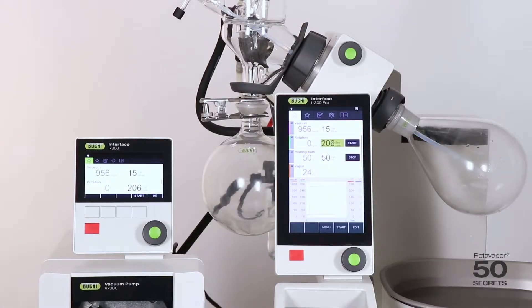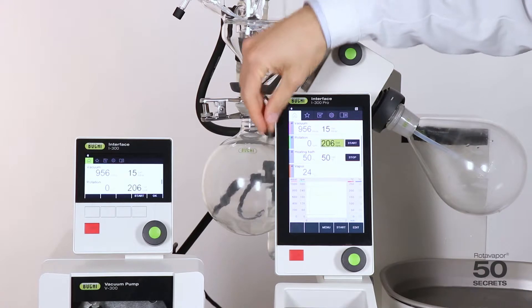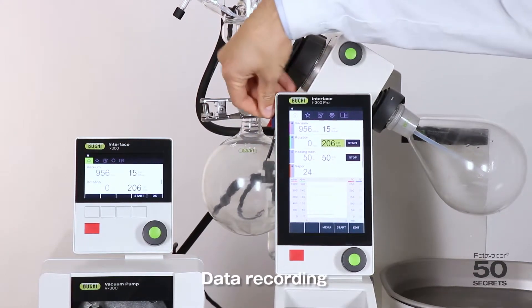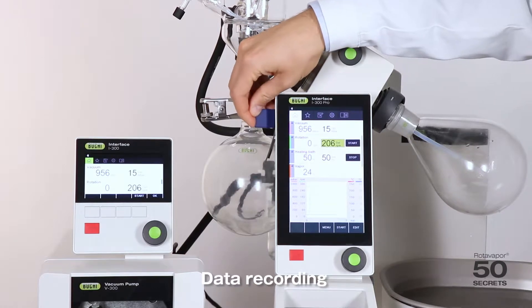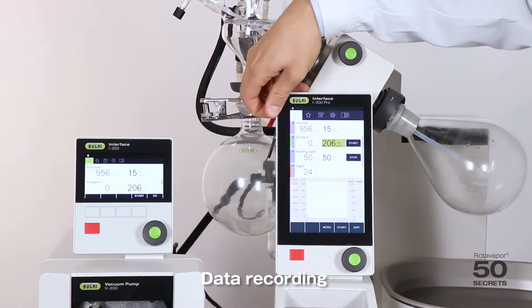The third difference is the recording possibilities. On the i300 Pro we have this SD card slot, which allows us to record the distillation.